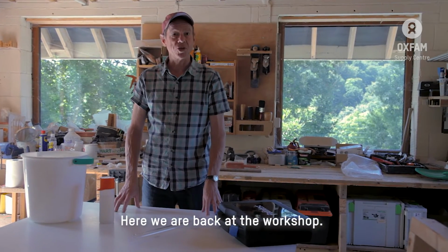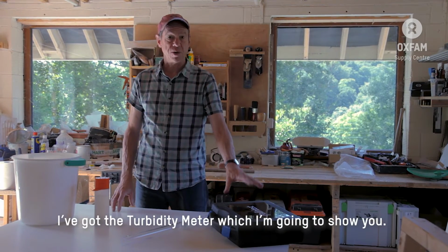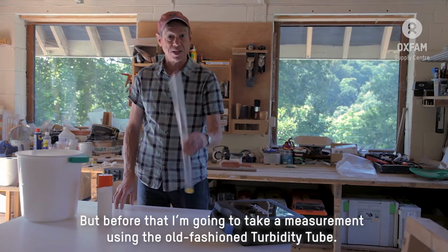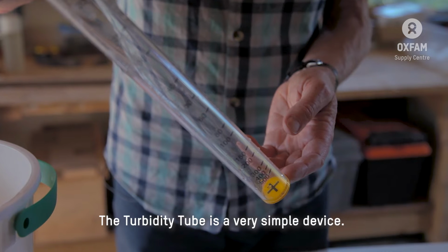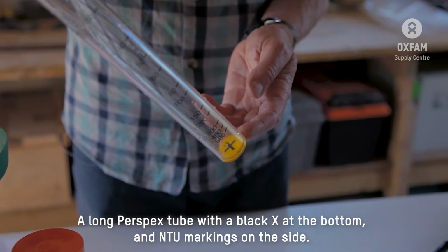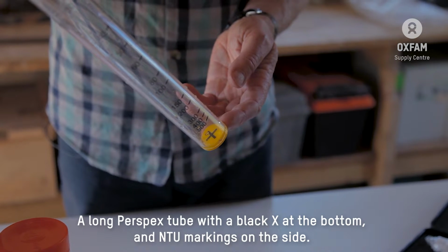Here we are back in the workshop. I've got my water sample we've just taken. I've got my turbidity meter, which I'll show you how to use. But before that, we're going to take a measurement using the old-fashioned turbidity tube. The turbidity tube is a very simple device, a long perspex tube with a black X at the bottom and NTU markings on the side.